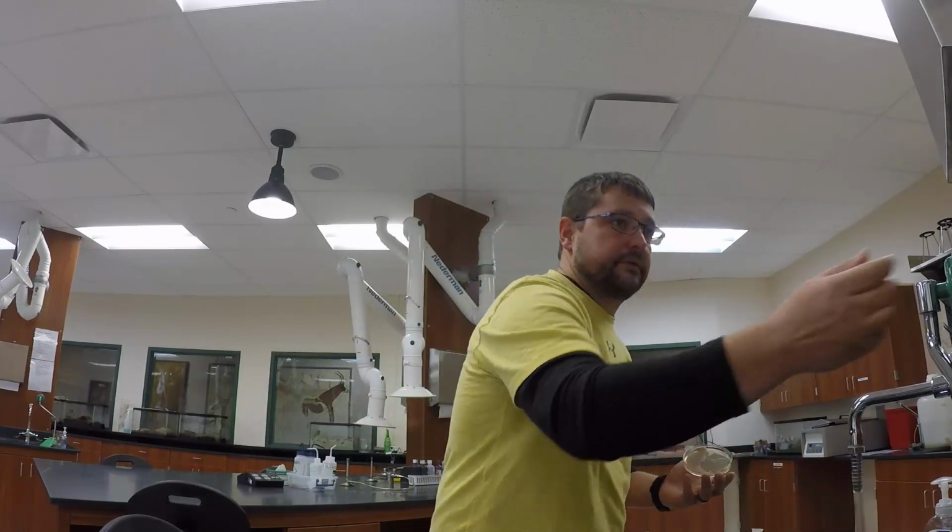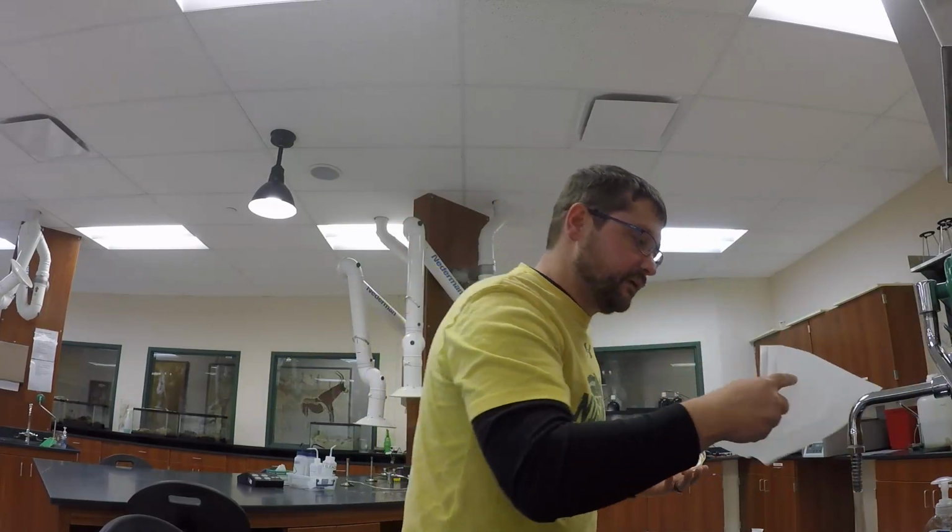It's kind of hard to talk. Okay. And then just like the other samples, I'm going to smear that material inside the center. Oh. Sorry. I have to wipe my nose. Alright. I'm going to put the lid on that. Okay. And we'll come back and inoculate that real quick.